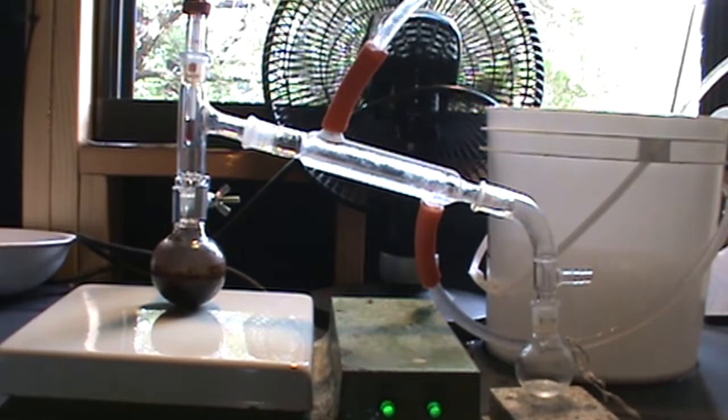After sitting overnight, the liquid in the flask had gone clear and there was unreacted red phosphorus sitting on the bottom.